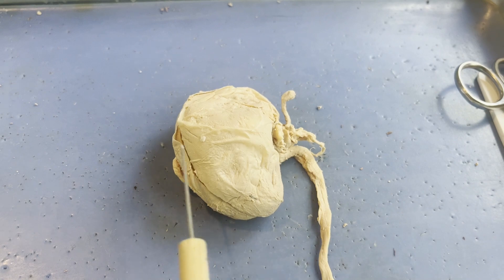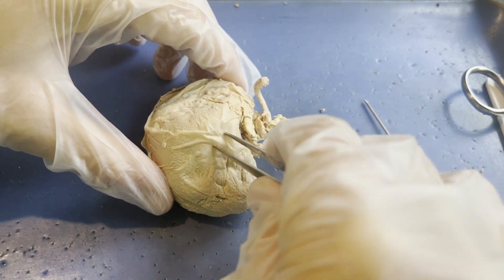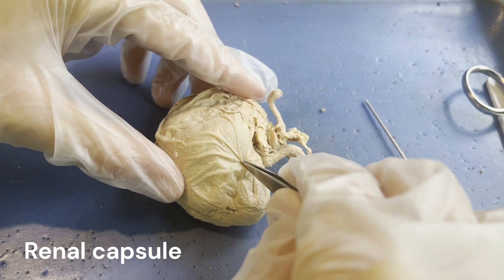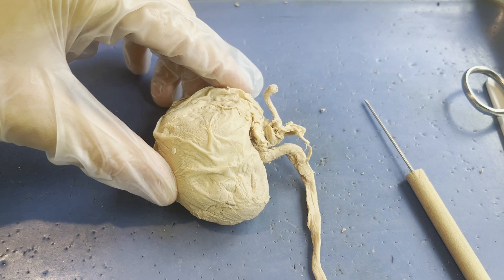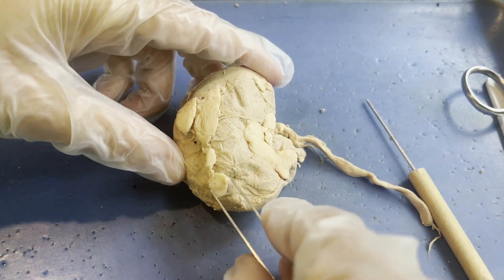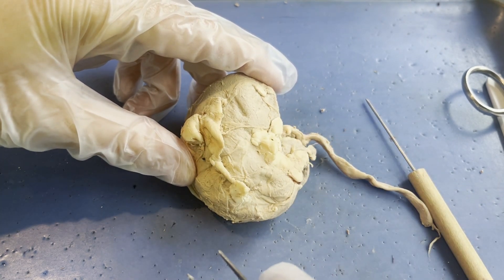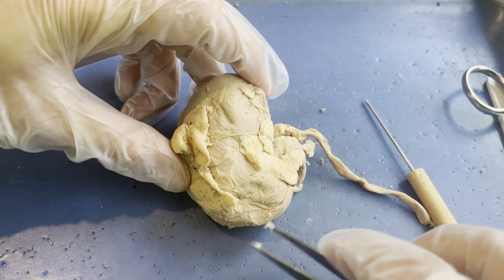Before we look at the internal filtration system, I want to show you a few more structures on the outside. The entire outside of the kidney is covered with a fibrous, dense type of connective tissue — you can see when I pull on it, it lifts up and covers the entire kidney. This is known as the renal capsule. This fibrous membrane protects all of the soft internal anatomy of the kidney. Your body also covers your kidneys in adipose tissue or fat as an extra insulator and cushioner, similar to how other precious organs like the heart and intestines have a membrane of adipose tissue around them to protect them. Most of it has been removed from this kidney, but you can still see some remnants.